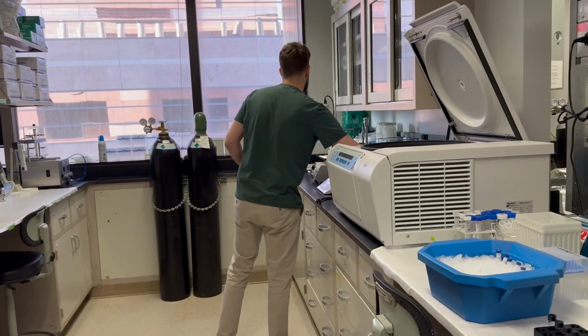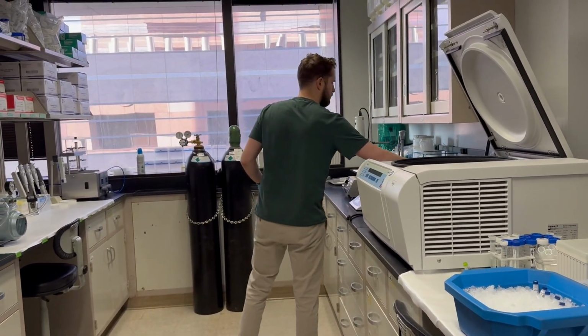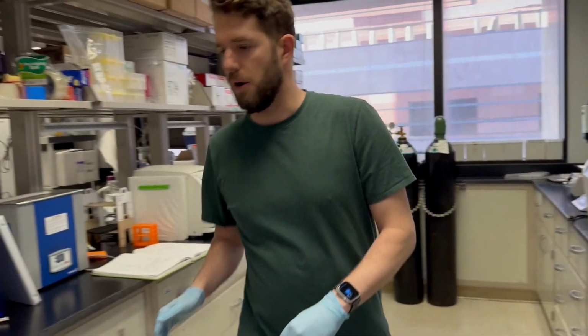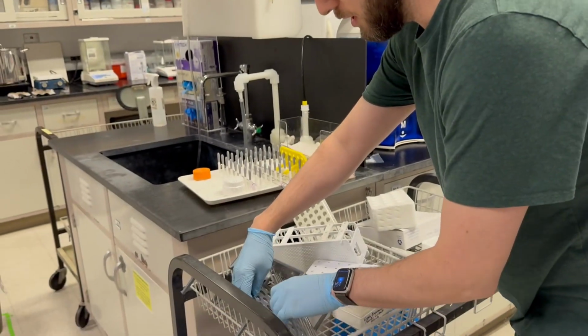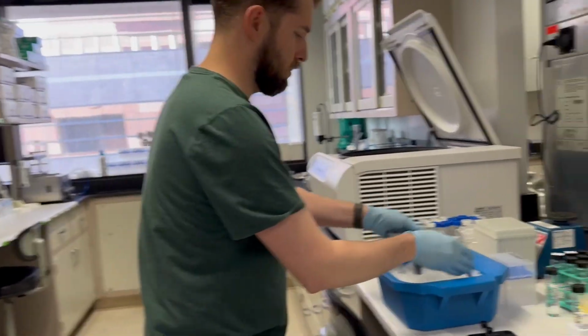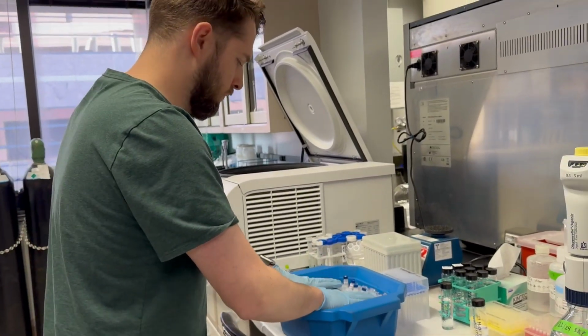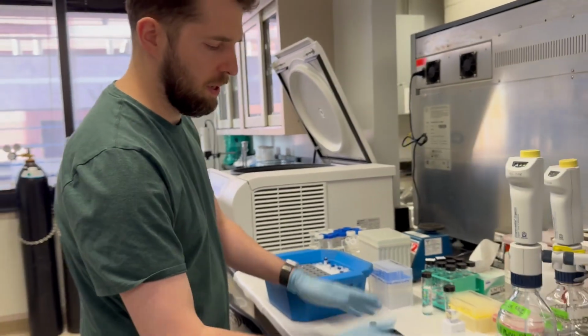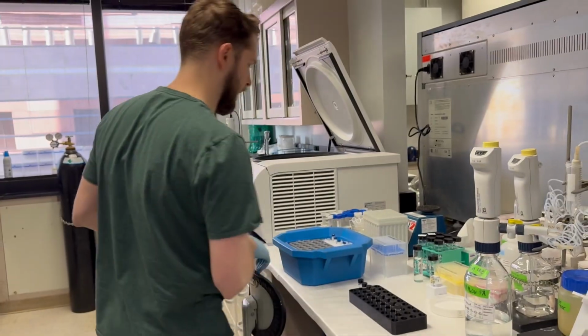One thing that can be helpful, we have some 3D printed vial organizers that you can use. Sometimes that's kind of nice to have. But if you're working quickly, you might be able to just do everything in the rack.